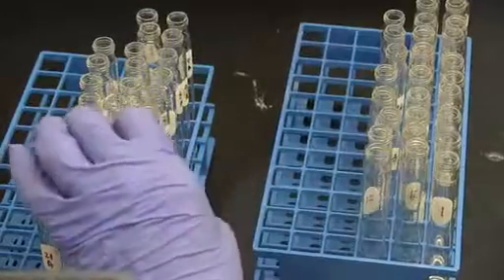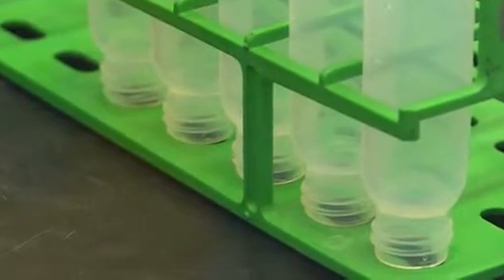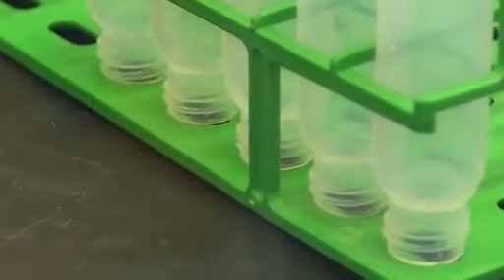All labware must be scrupulously clean. Any residual detergent, grease, or dirt can impact the results by appearing as a peak in the final GC chromatogram.